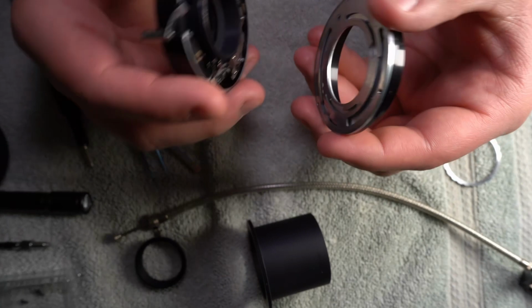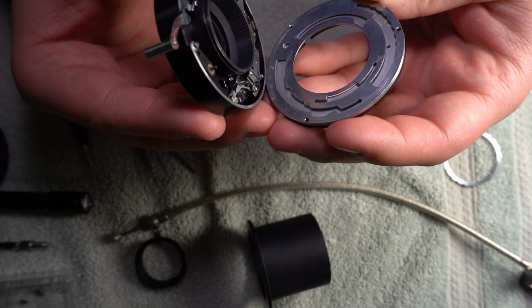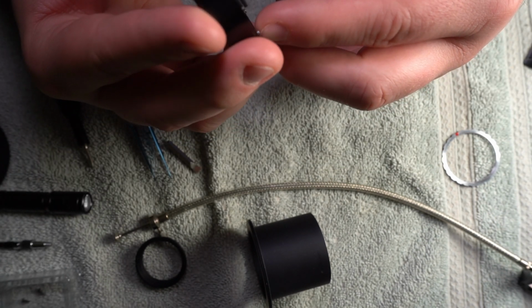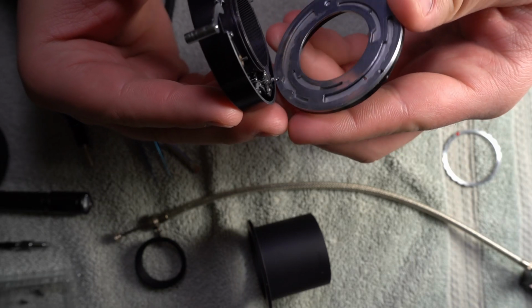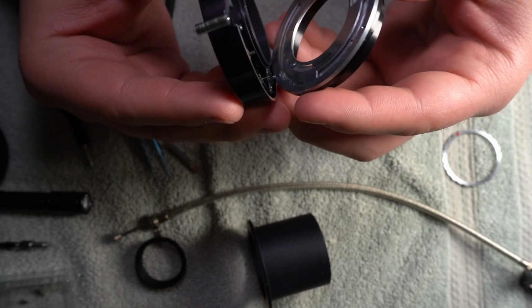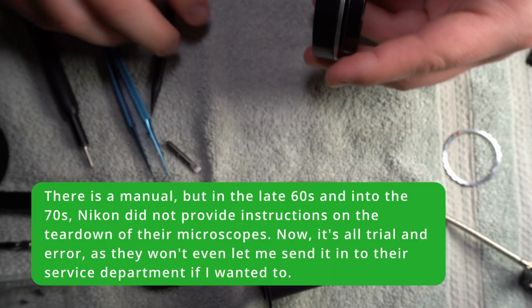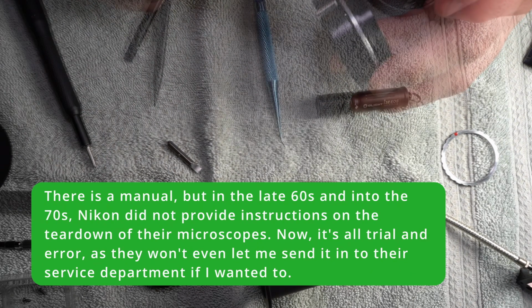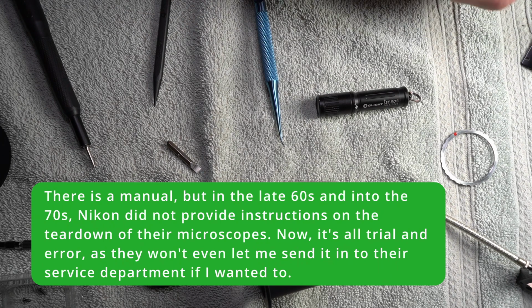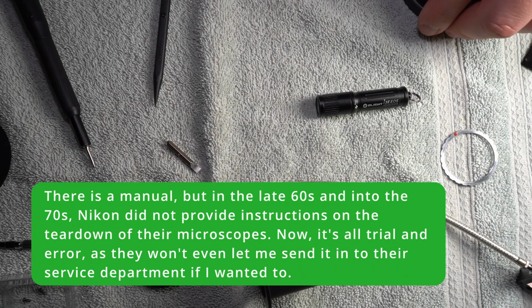See, the problem with this... I'm sorry, I'm off camera with this. The problem with this is that there's not really a manual for this. Maybe I can get at it this way. I think I can. That goes in there, I think. I don't know how it goes. I think I'm just going to put it on, see what happens.